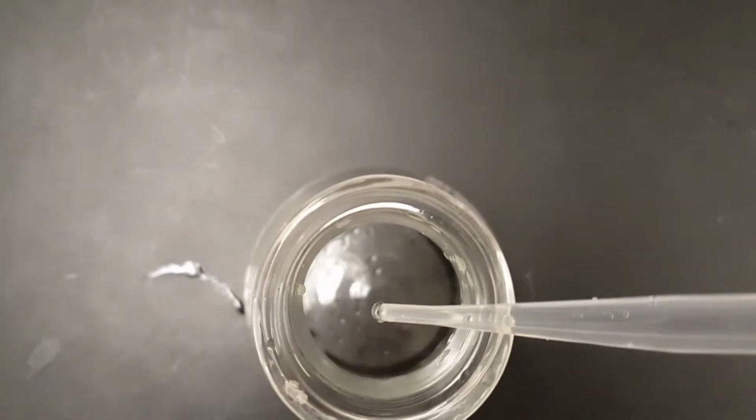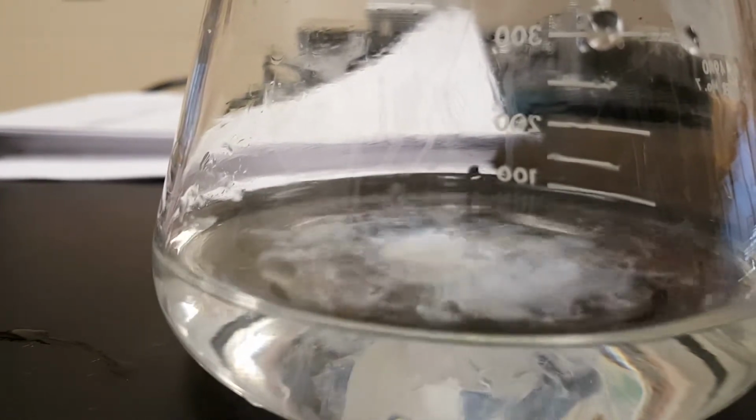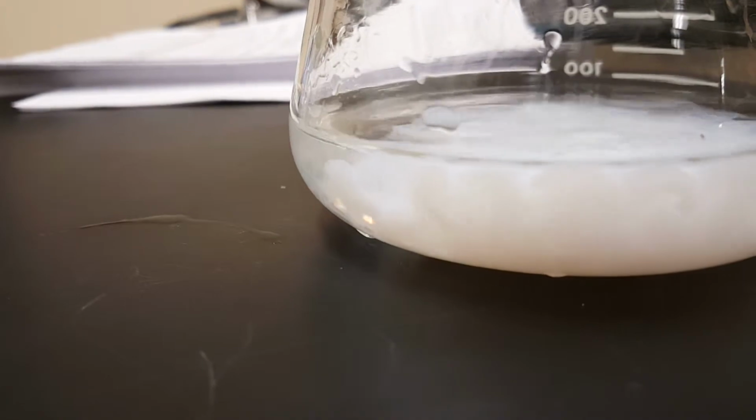Keep an eye. You see that? See the stuff fall to the bottom? Let me try from this angle here. You can watch, in an instant, a white solid forms. This is what we call precipitation. See, it kind of falls to the bottom there. Looks like cloudy, wispy stuff falling there. And the question is, what is that stuff? See that white cloudy? It's actually a solid, an insoluble solid that we could identify.